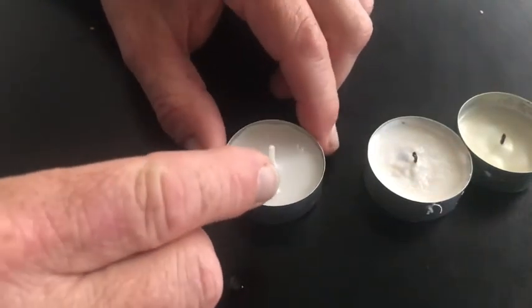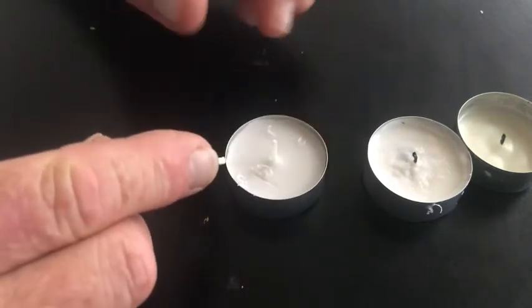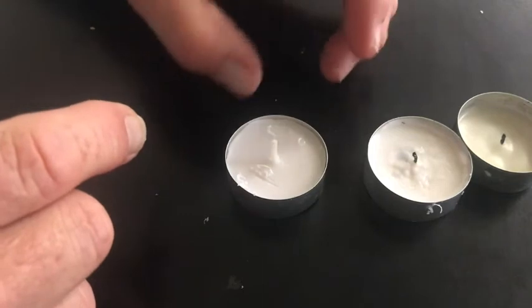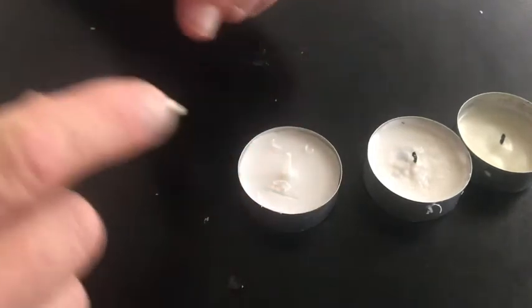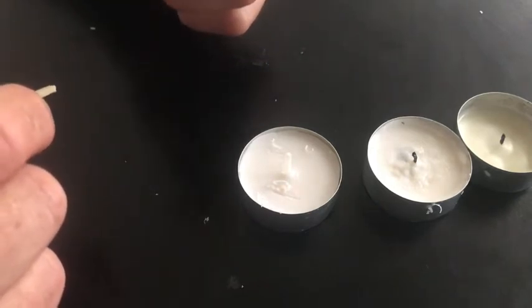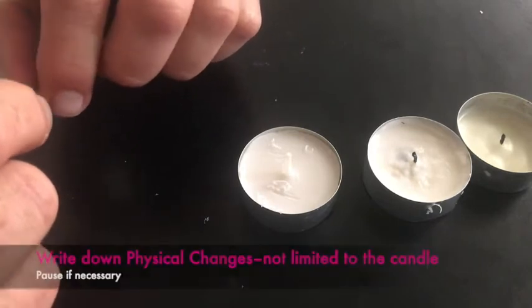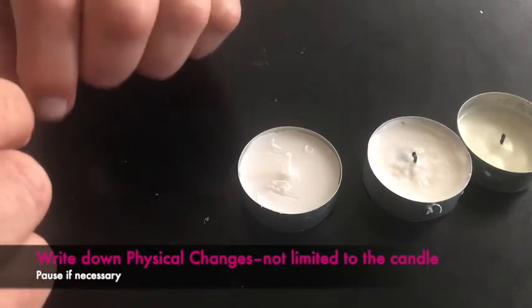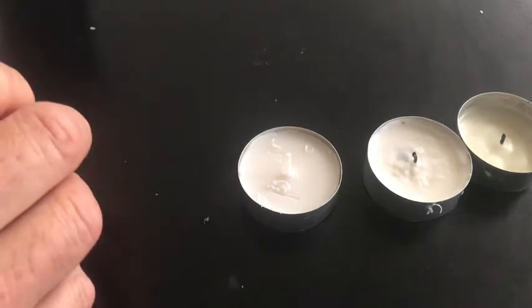I have now drawn in it, and what I did is I cut the wax up. But did it change into a different substance? No, it's still the same wax. It's just that I have these little shavings now. So that's called a physical change because I wasn't able to change it into a new substance. A chemical change is one where we create a brand new substance.